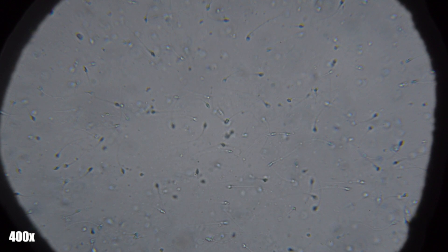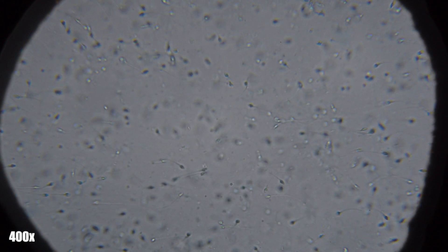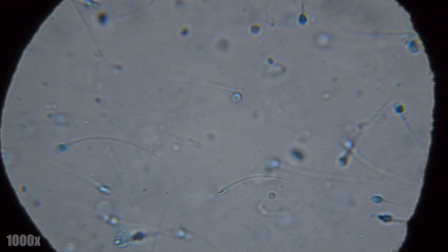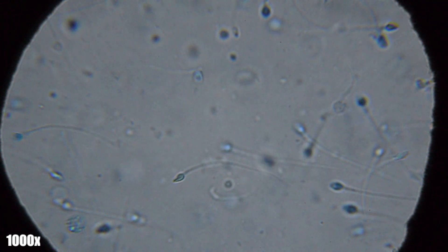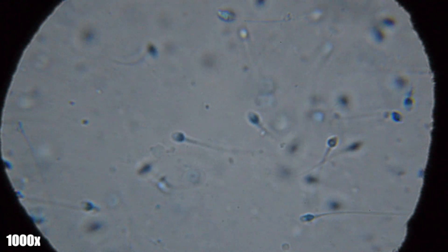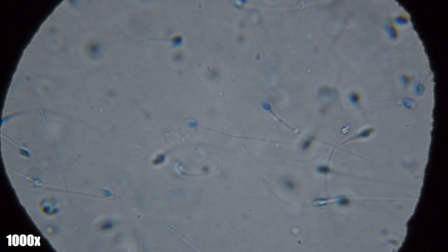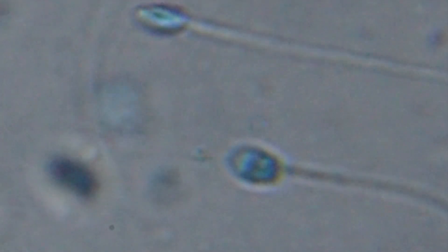Here are the immobilized sperm after using ethanol. The head of the sperm is covered in a shell called the acrosome, which contains digestive enzymes used to deteriorate the protective covering of an egg so that the sperm can inject its DNA into the egg. When the acrosome binds to the egg, the egg's outer covering depolarizes, preventing any further sperm from attaching.